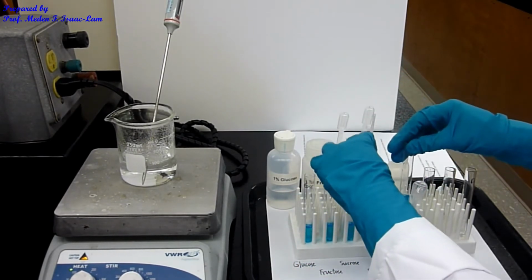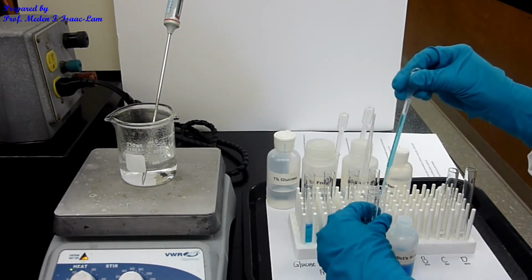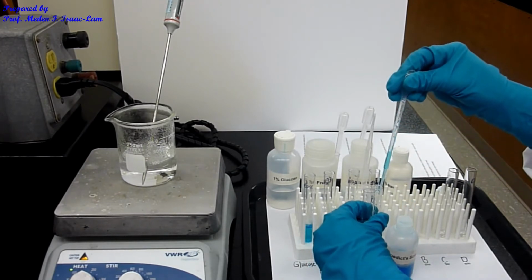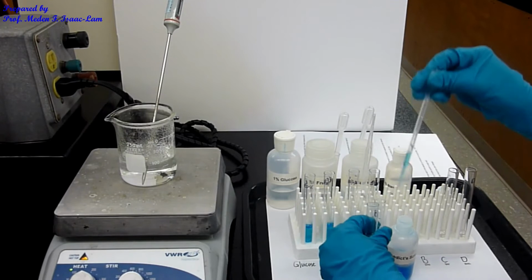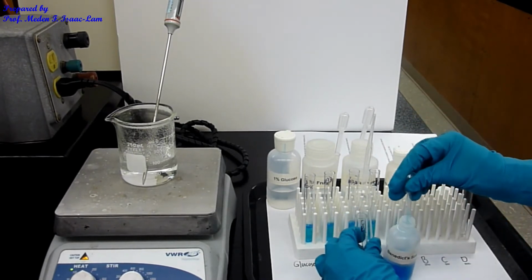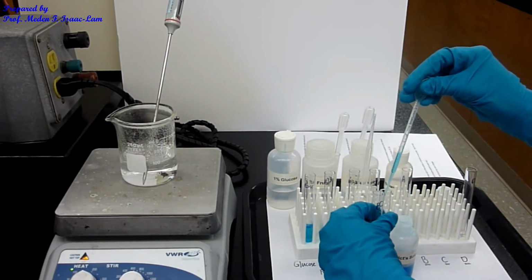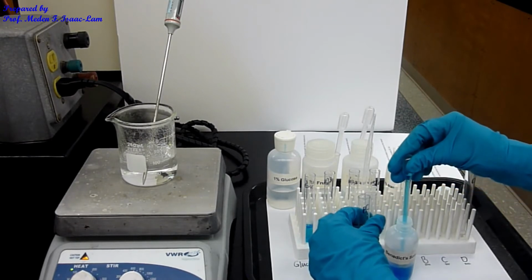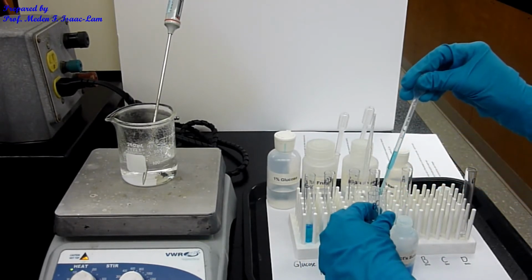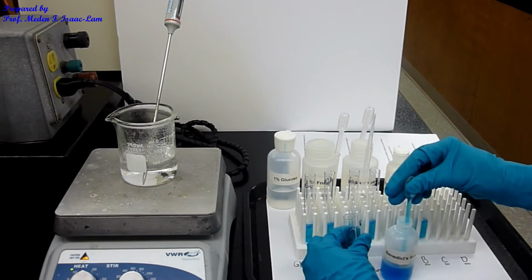That's A, and we're now doing B. Now I'm doing C. Last one is D. So 4 unknowns.